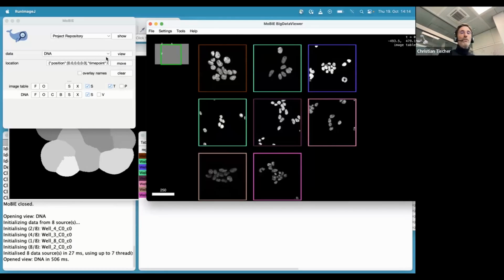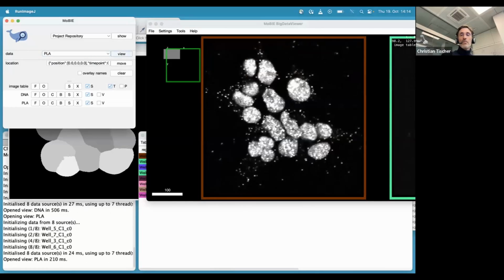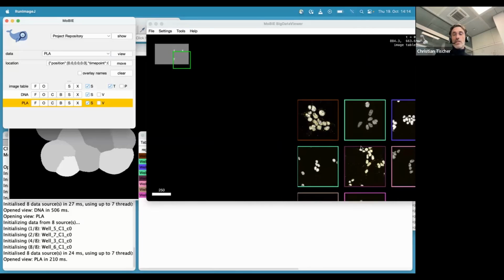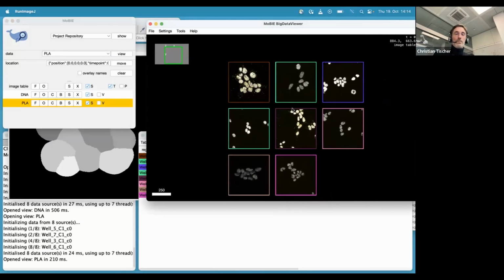Then we really care about these PLA spots. So let's also add them. So they are now here, and then you can do standard stuff like changing the color. So maybe let's make them orange or something like that, right? So you have standard functionality. You can change brightness, contrast, and so on.